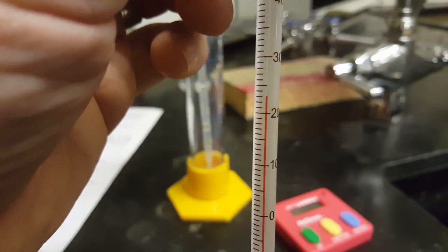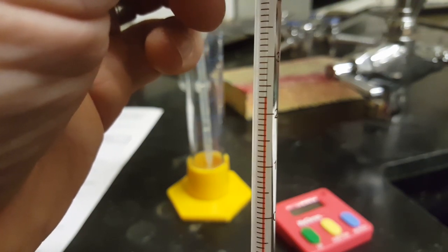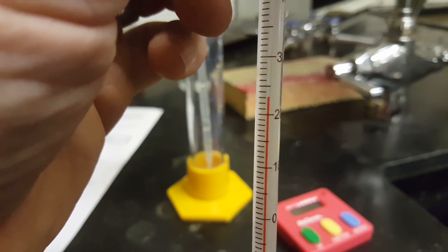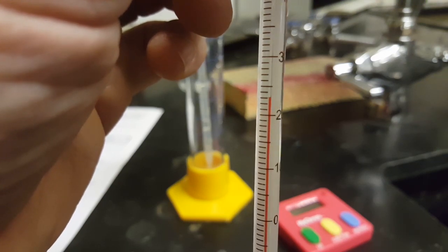Make sure once all your salt's dissolved that you've measured the temperature change. There's a temperature change for dissolving salts, and it has to do with bonds broken and bonds made during the dissolving. We'll learn a lot more about that this year.